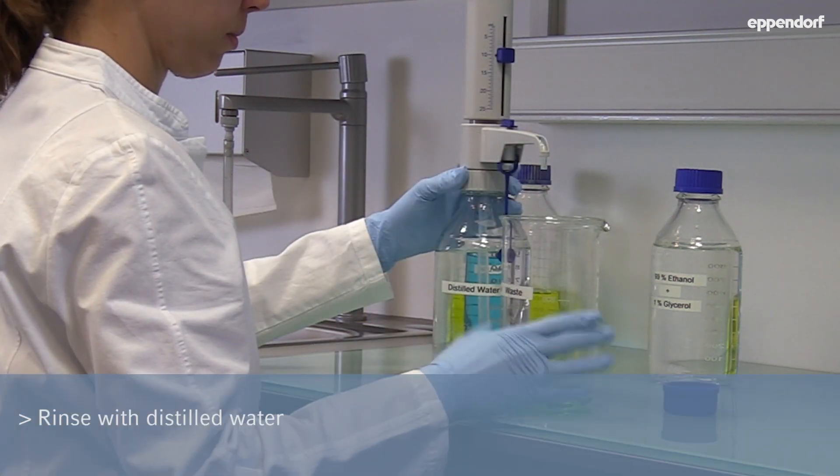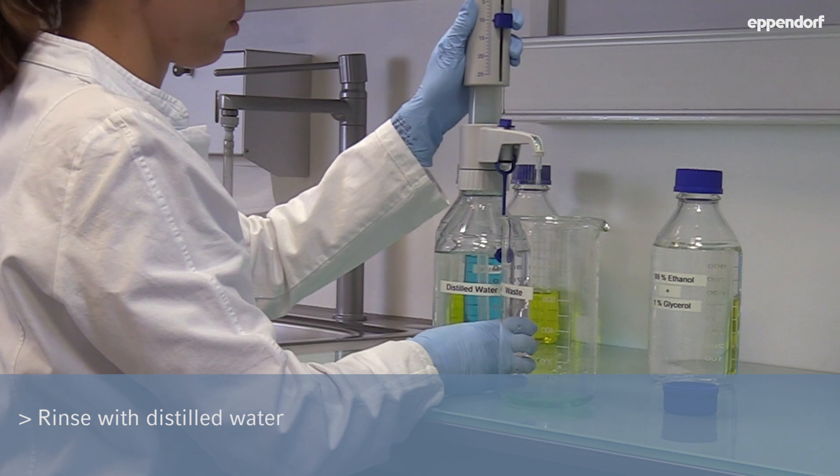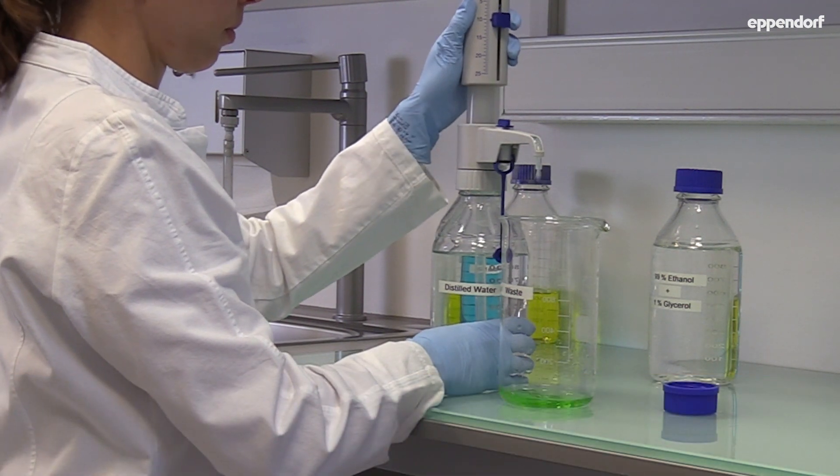Then attach it to the distilled water bottle and rinse a couple of times. Detach the dispenser.